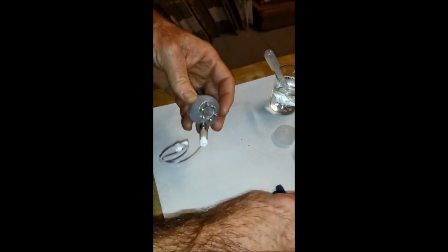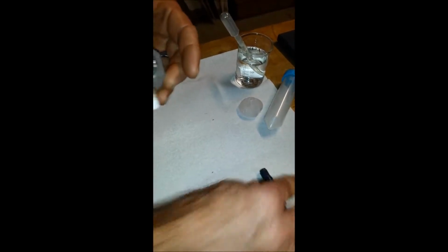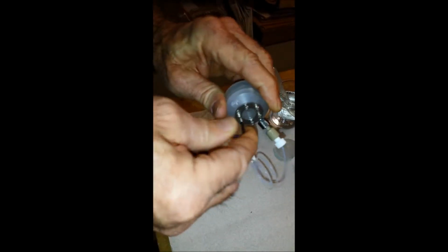Then you take out the reference electrode, carefully laying it down. It's okay not to cover the top if it's going to be only a few minutes. And then you're going to remove all of the set screws.